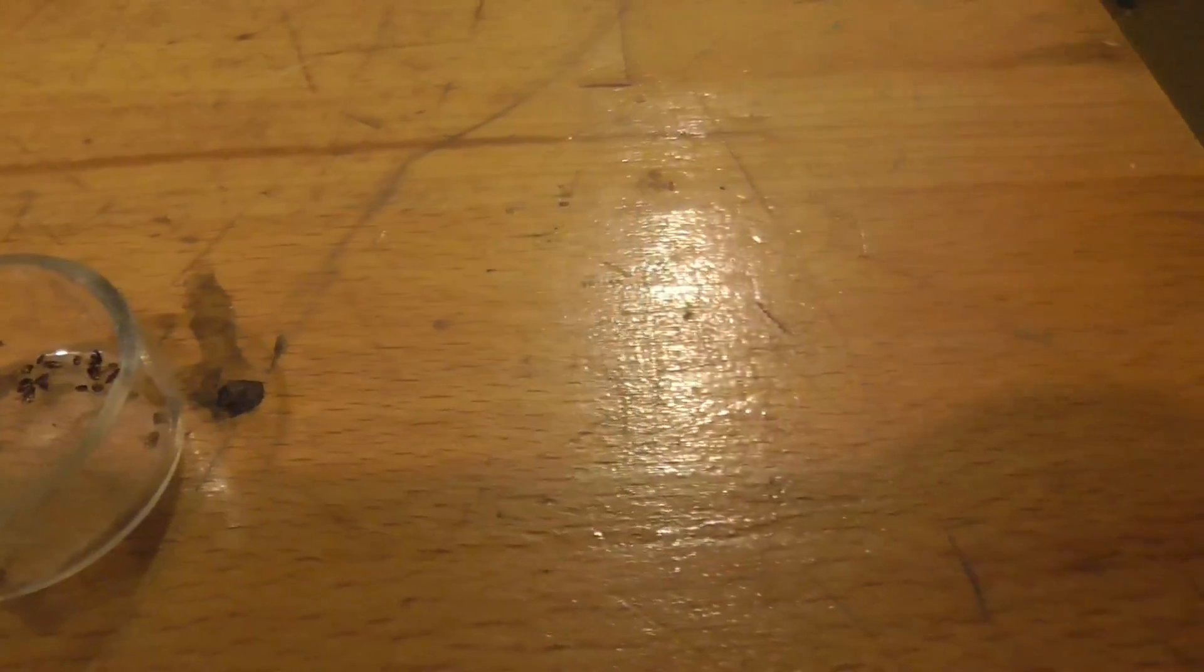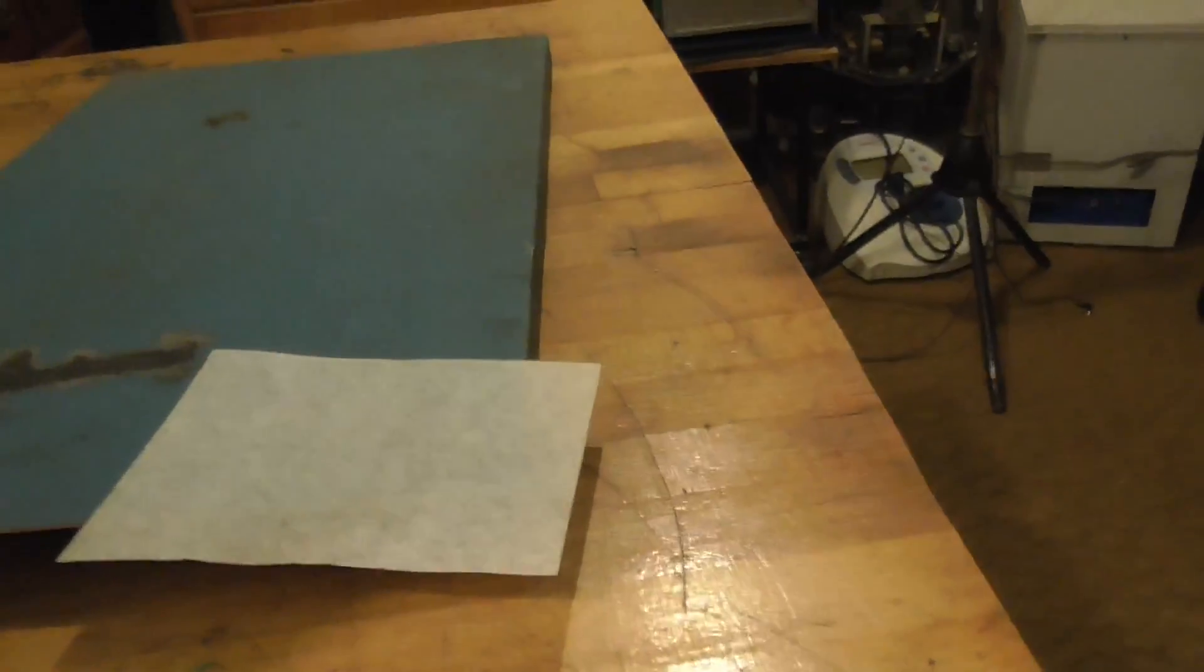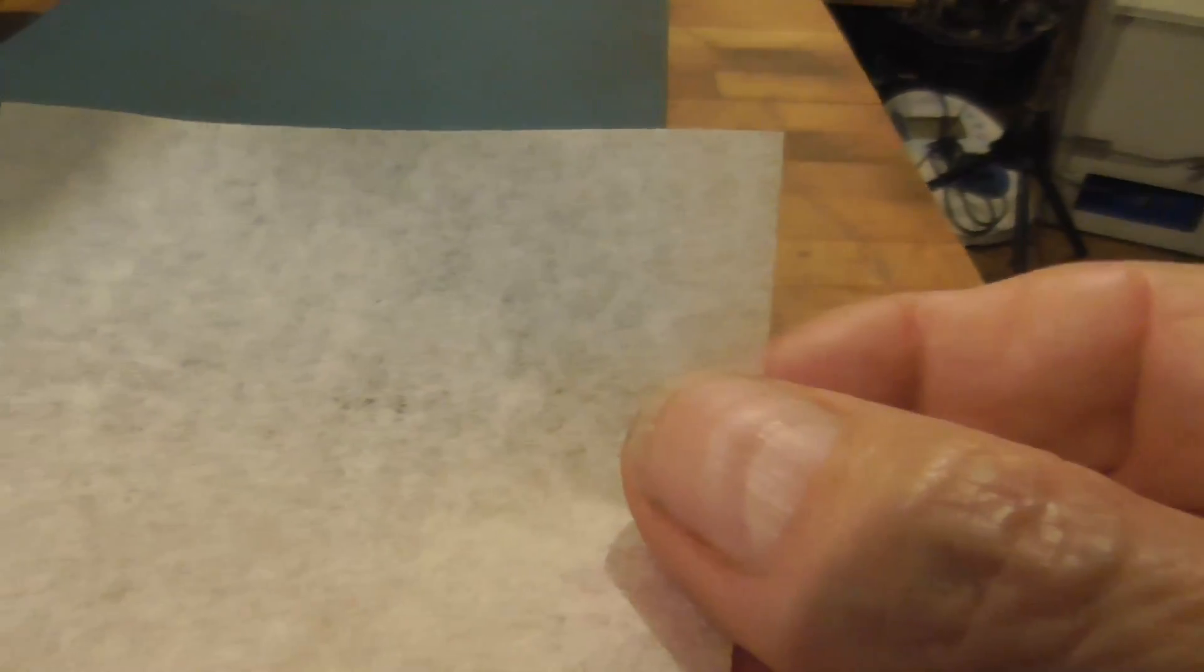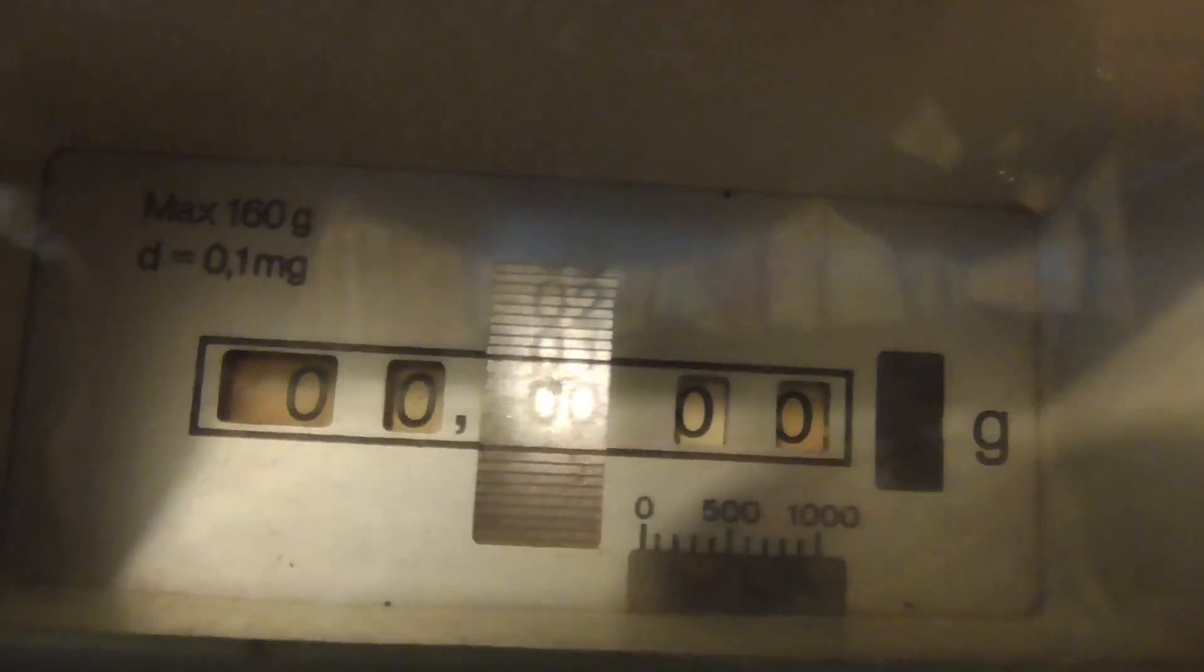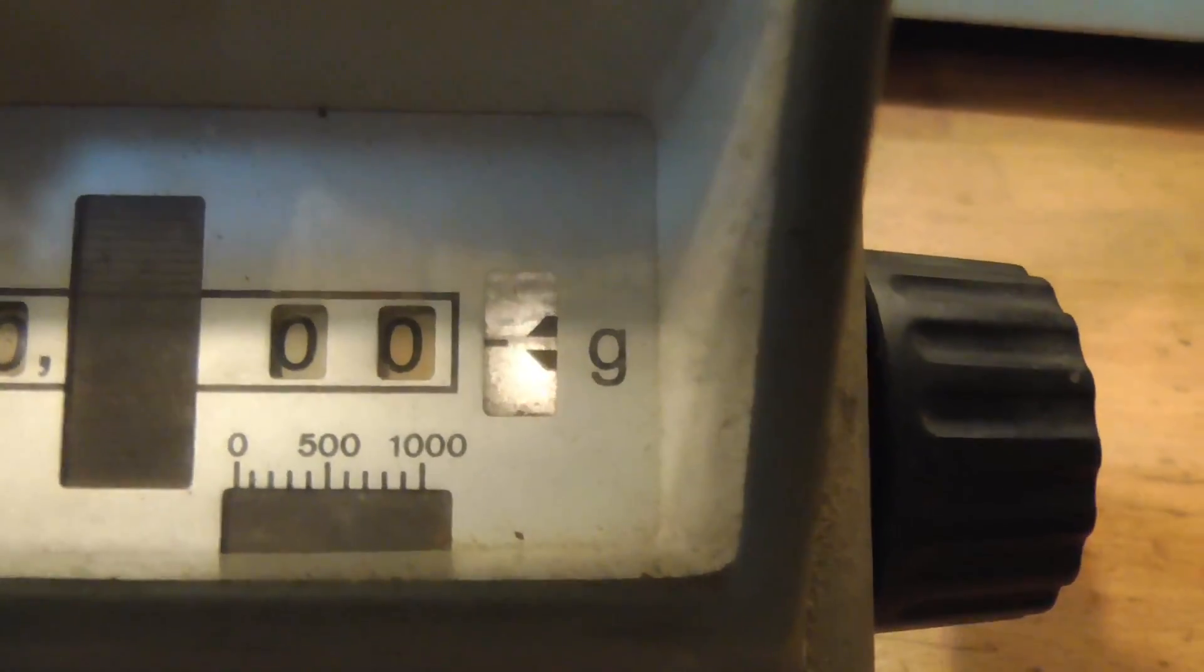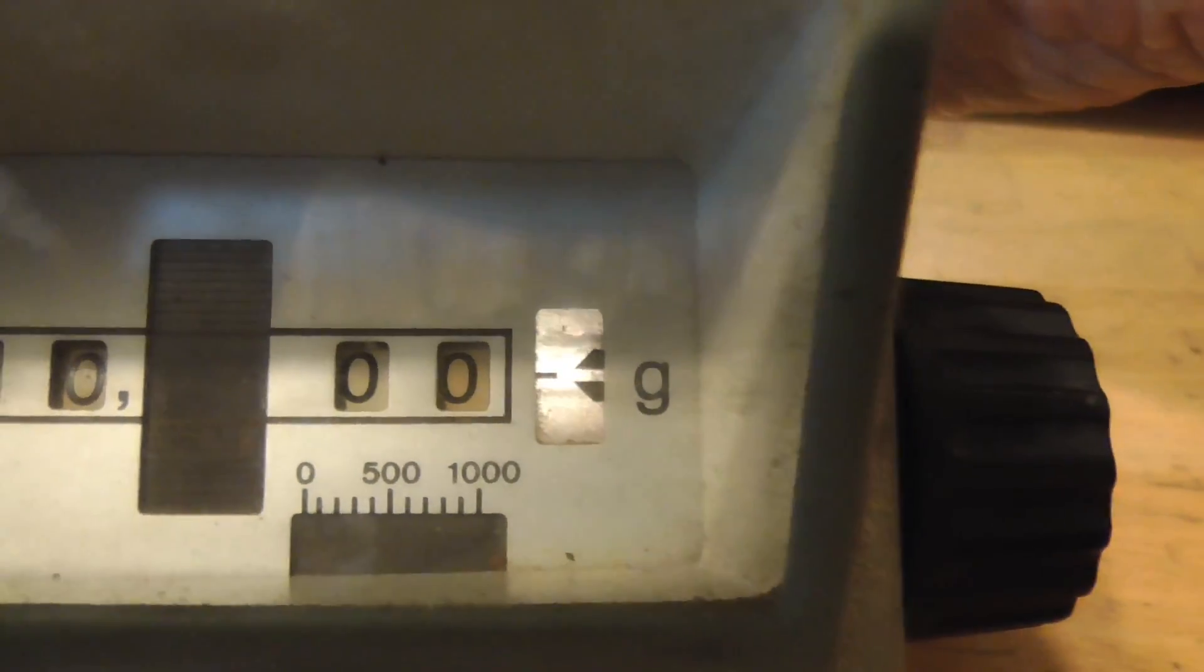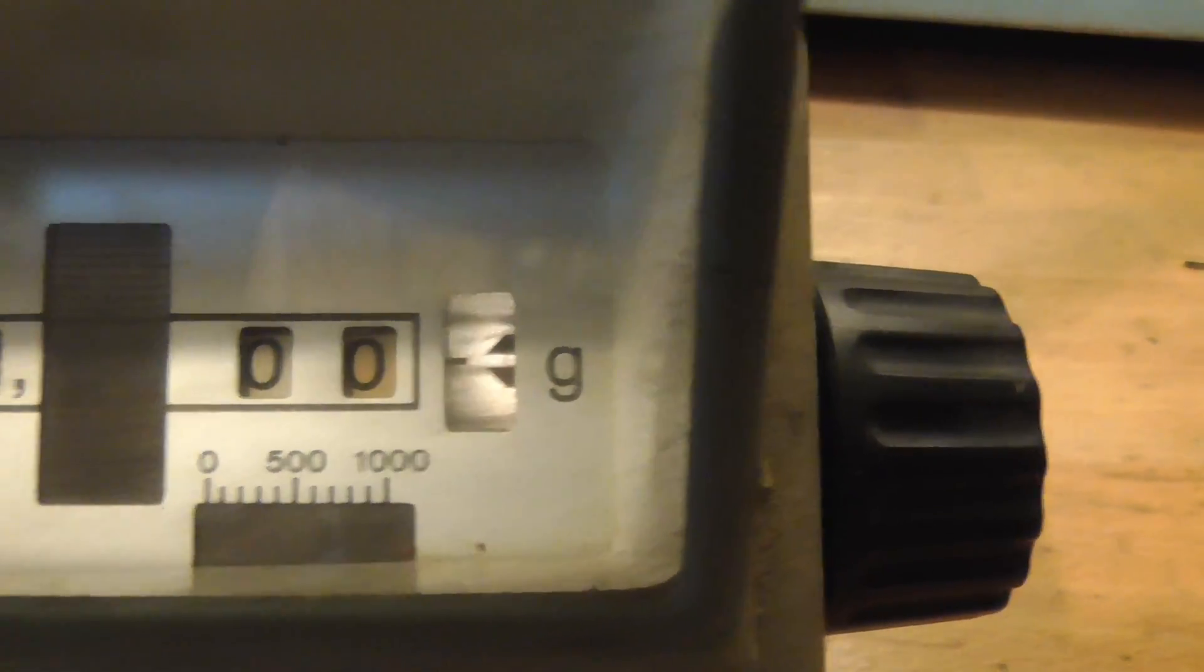So what I'm going to do, I'm going to take a piece of paper. I have a piece of weighing paper here. This is very thin paper because we don't want to just put the fleas straight on the pan because we'll have a hard time getting them off again. We look here and we see we're absolutely zeroed. I'm going to set this piece of paper on the scale. It changed.